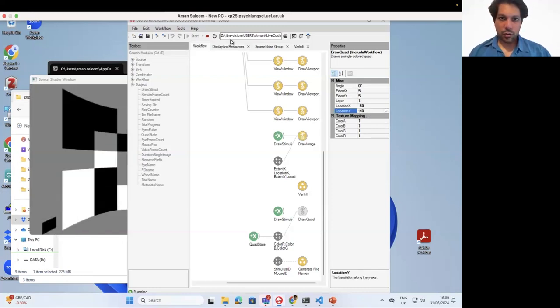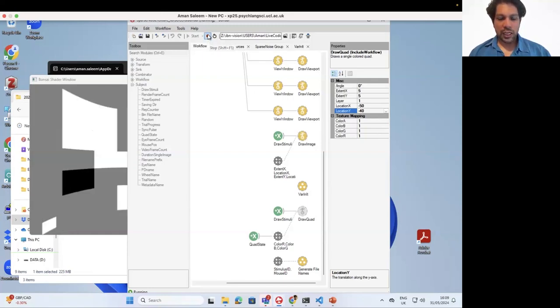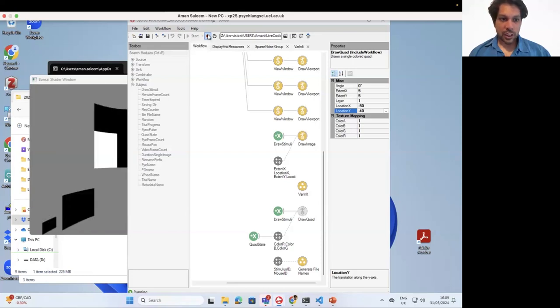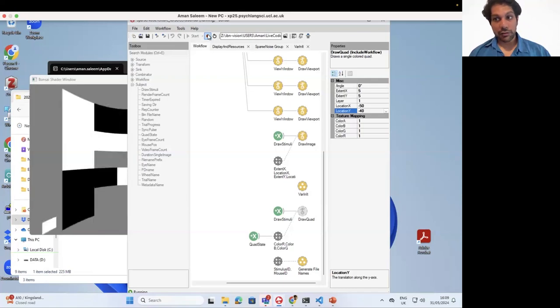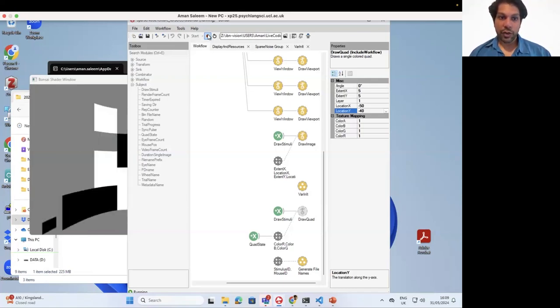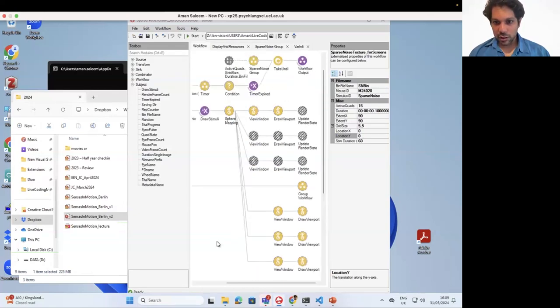Okay, so what is happening here? Basically, every time we have a stimulus refresh, it is flipping from black to white. So you have the timing of every frame change in the stimulus. And it's basically the same kind of strategy.